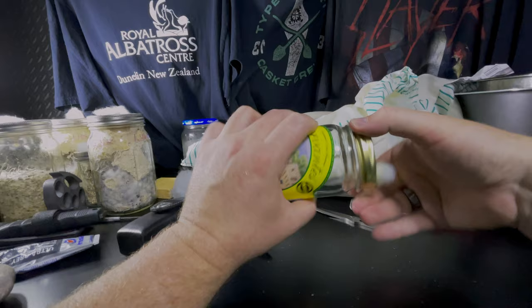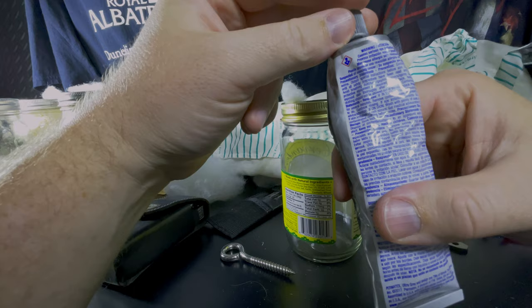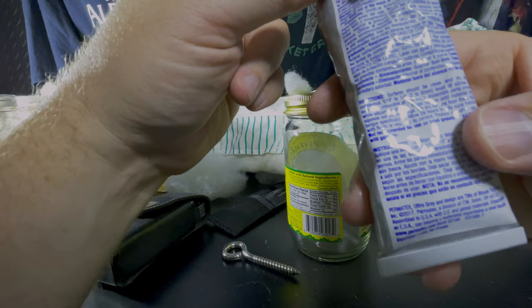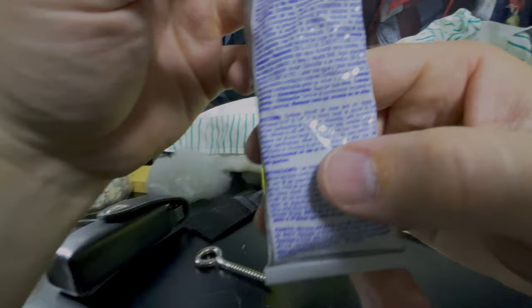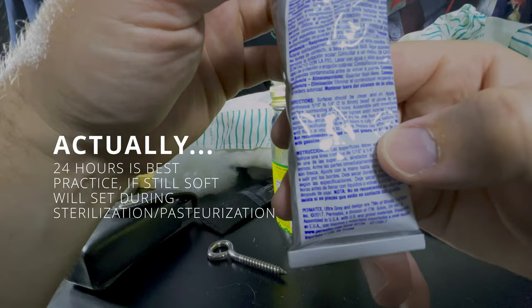I think every video I've watched in the past, they're like, make sure it's completely dry before you pressure cook it. And I'm like, why? Heat usually makes things set faster. Okay, so this one clearly says allow 24 hours to fully cure before filling with fluids or returning to service. This is for a car.